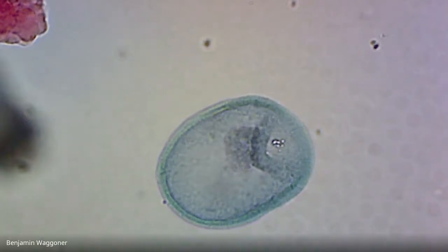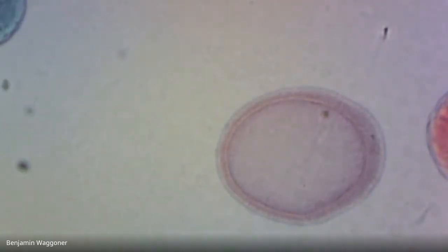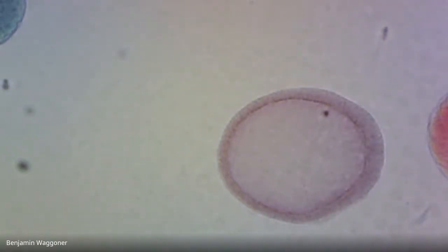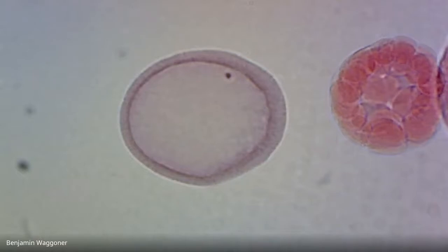And I'm going to try to find a later gastrula. Some of the things on this slide are kind of glommed together, but let's see. I had some good ones around here somewhere. Okay, that's a blastula right there. I'm not seeing any cells wandering in, so that's probably not a gastrula at all yet. But you can still see it's hollow.